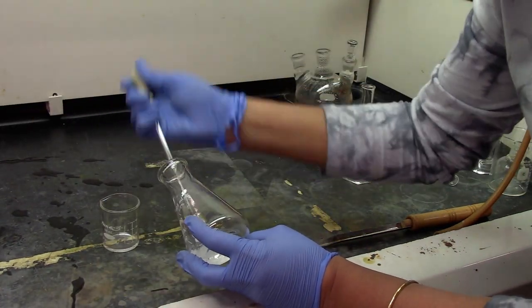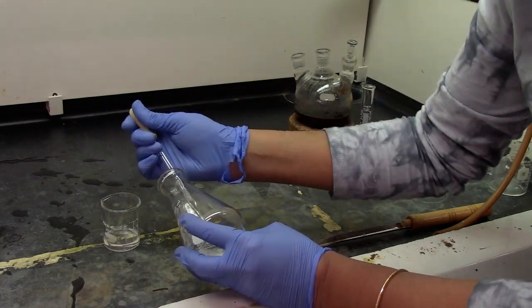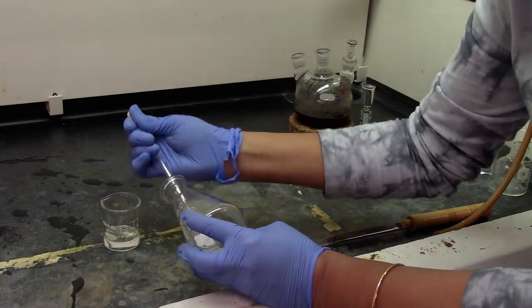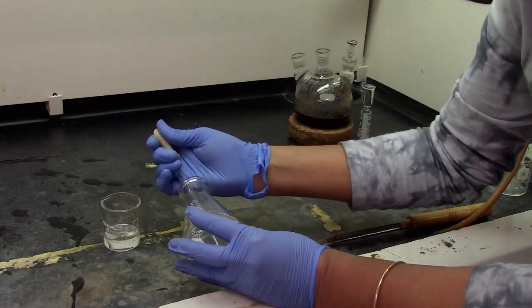Use a glass pipette to transfer the liquid into the 50 ml beaker carefully. Do not transfer any solid into the beaker.